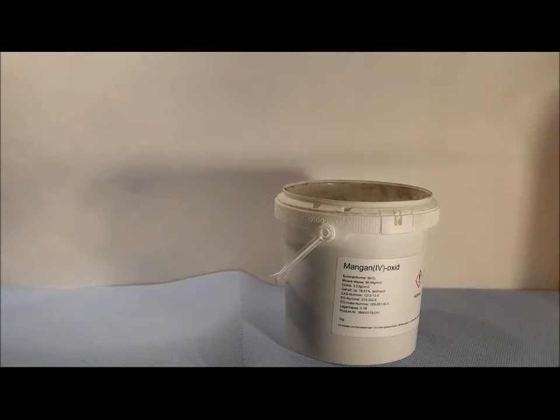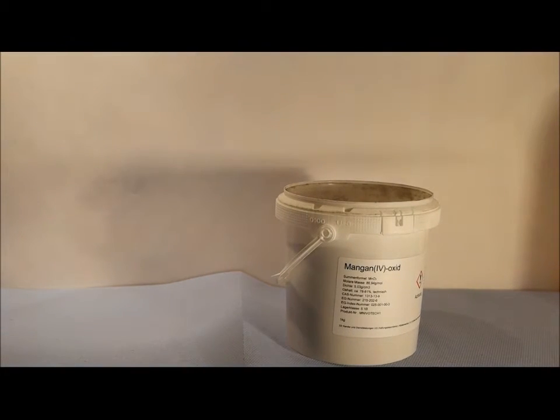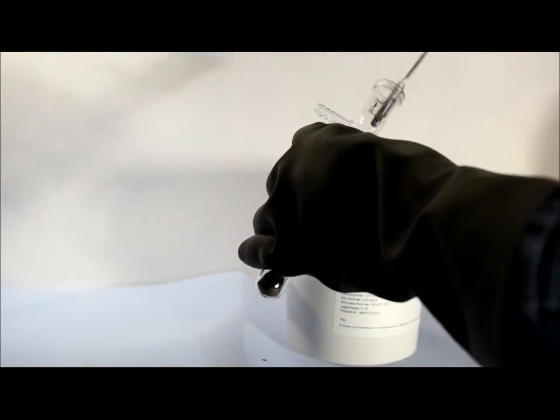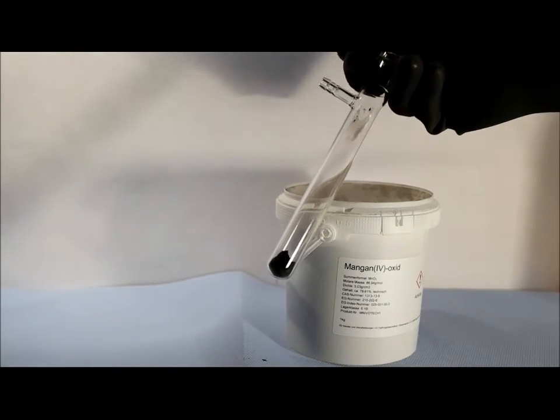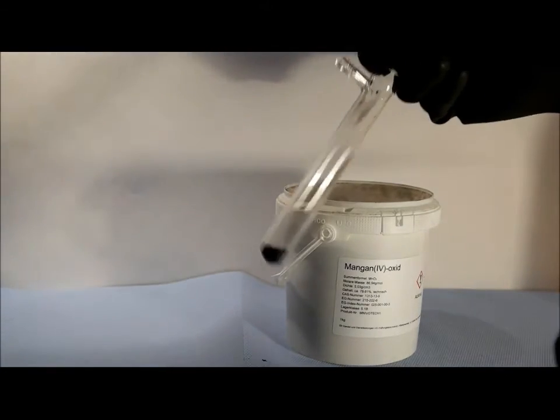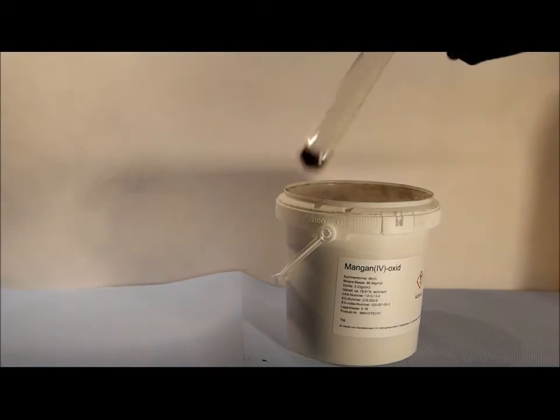Start by putting a small amount of manganese dioxide in your test tube. You don't need much because as you may know a catalyst isn't used in a reaction. So this is maybe around half a gram and that's enough.